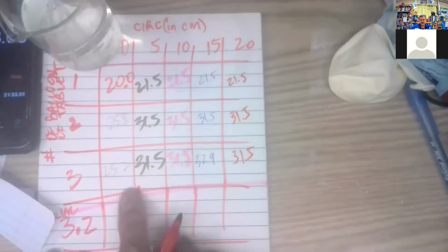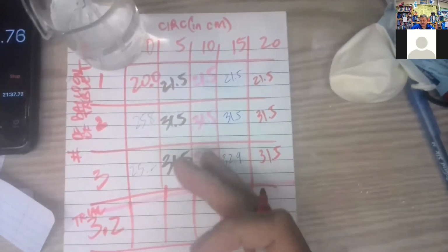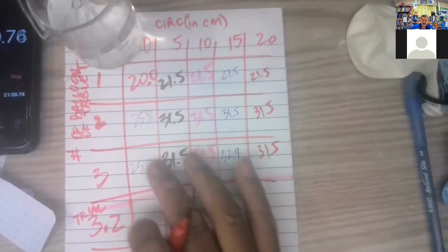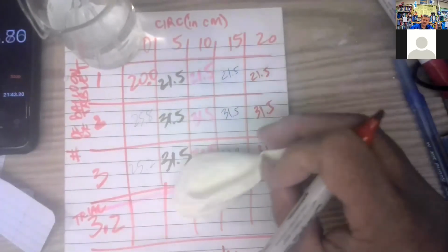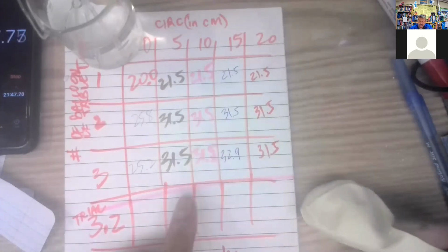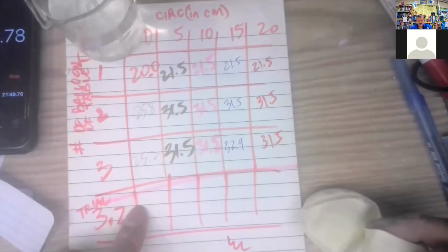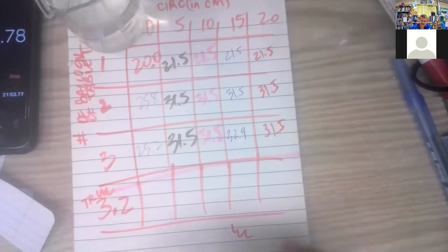So I wonder if I can do a better job at getting the 3 tablet balloon going. And looks like according to this, if I let it go for 5 minutes, it should be about done.